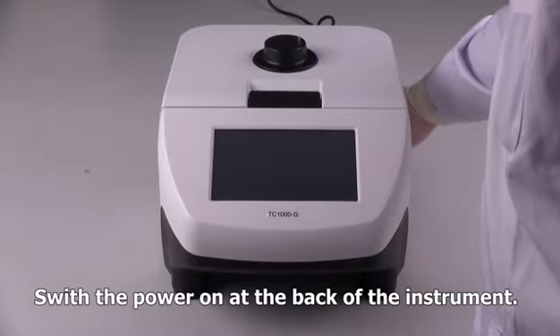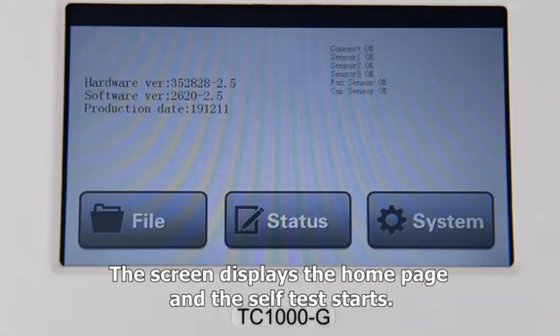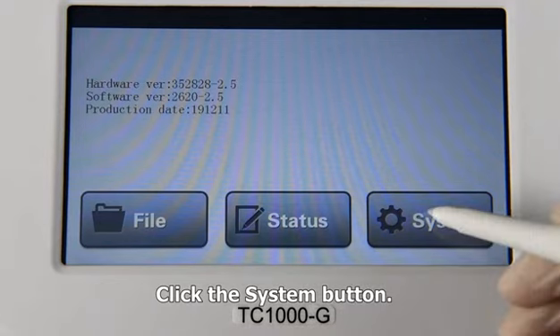PCR thermal cycler. Switch the power on at the back of the instrument. The screen displays the home page and the self-test starts. System settings. Click the System button.